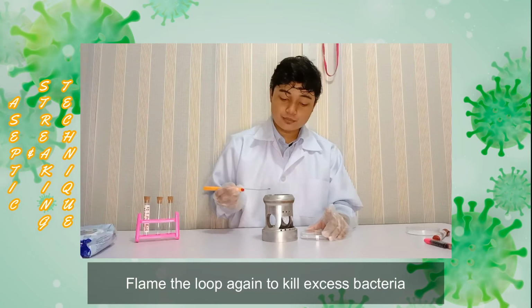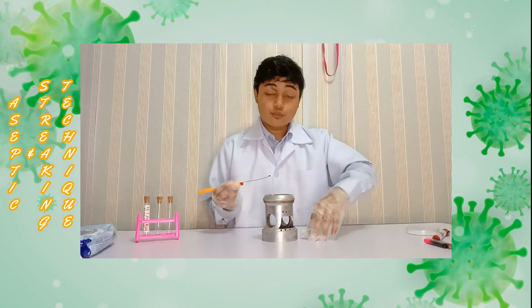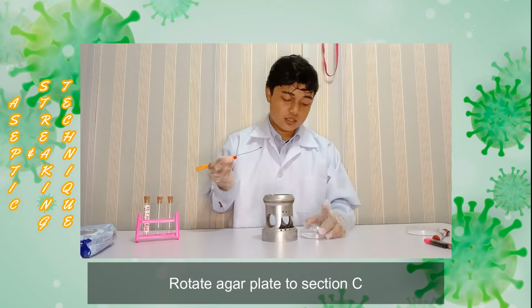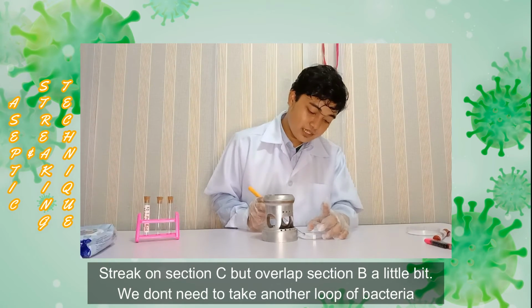Then we need to flame again the inoculating loop until it glows to kill the excess microorganisms. Then we repeat again for section C. When the loop has already cooled down, we will streak it on section C, and overlap a little bit on section B.